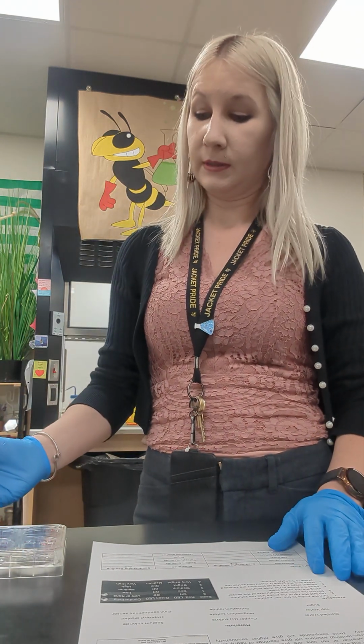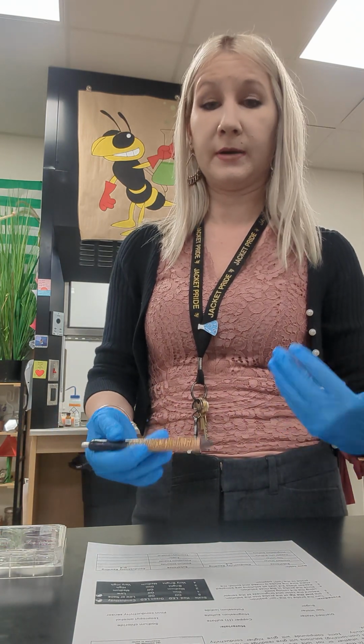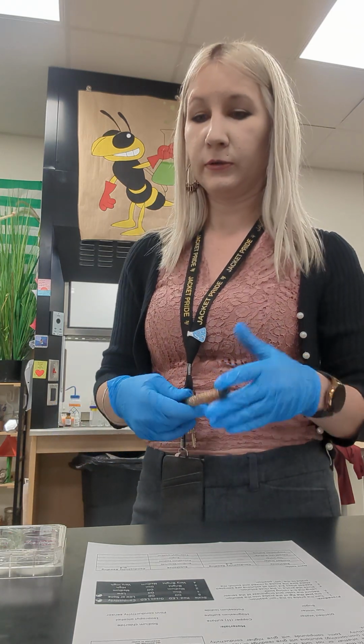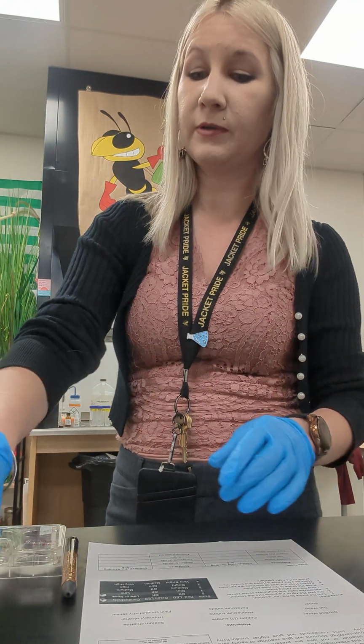Morning class. Today we're going to be testing solutions to figure out whether they're ionic or covalent. Ionic bonds will be able to generate a substantial electrical current, whereas covalent bonds, not so much, very little to no current.